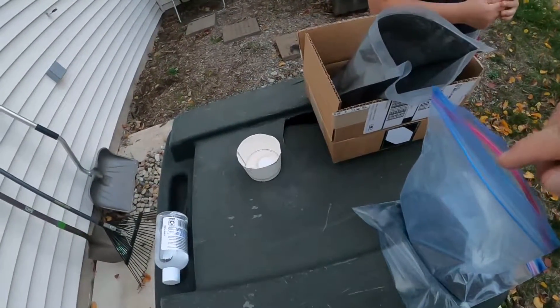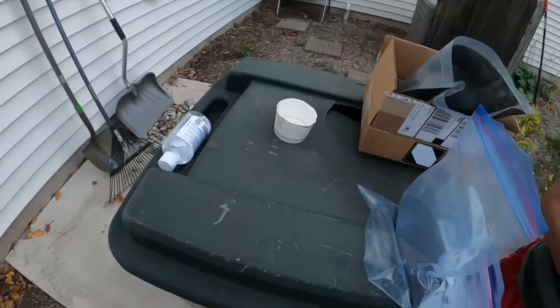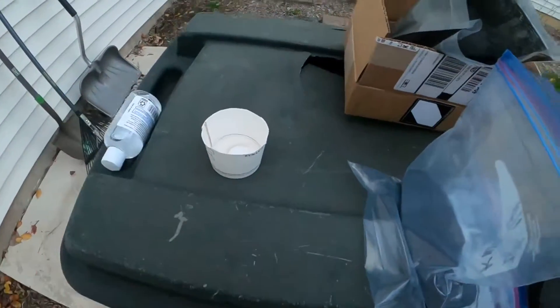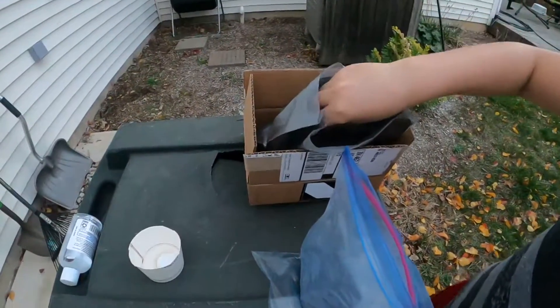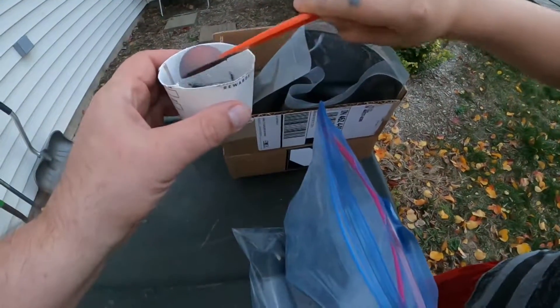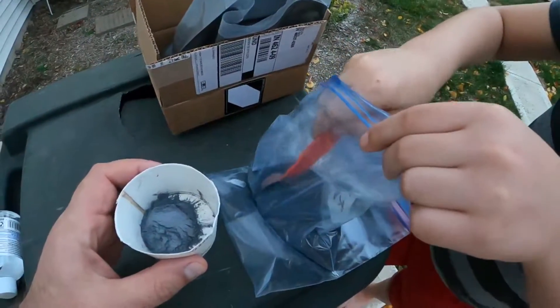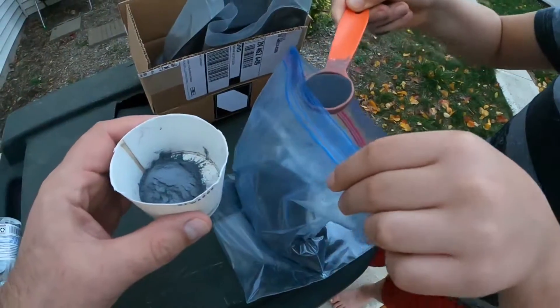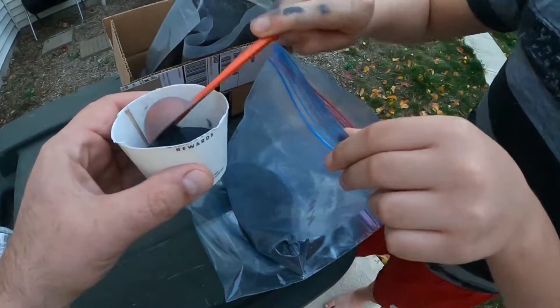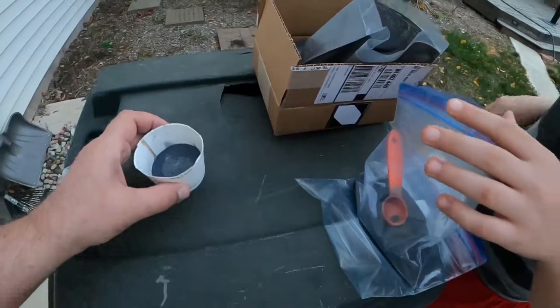Let's mix it up. I have this special container. Give me ingredient number one — just one scoop, not too big. Yeah, that's fine. Second one — don't inhale that, it's very toxic, extremely. A little bit more. Yeah, that's fine.